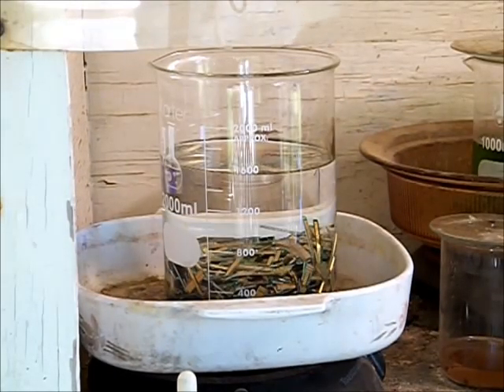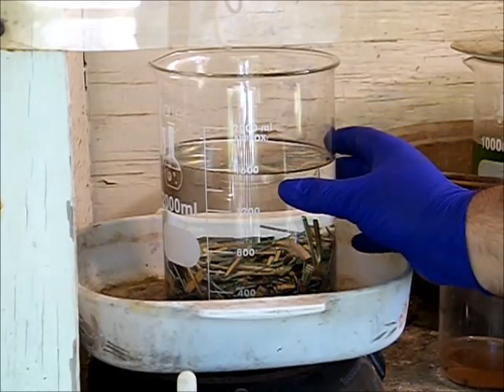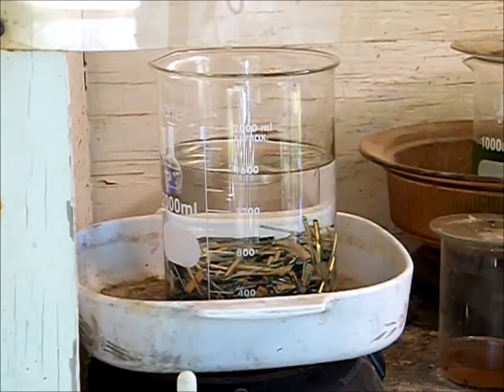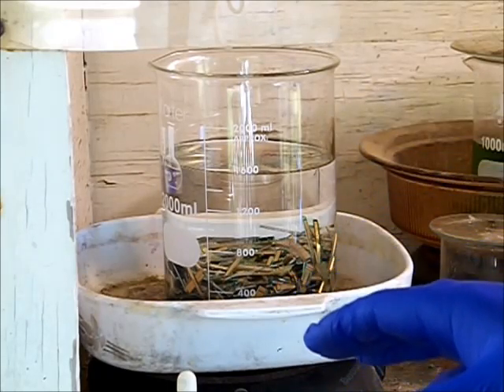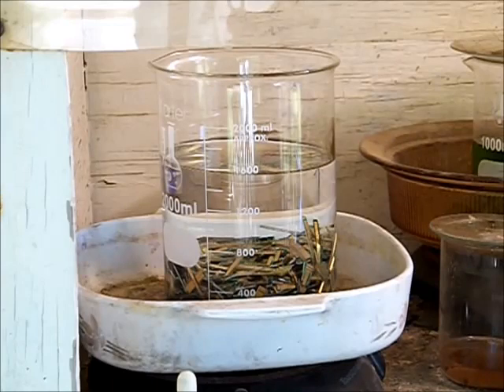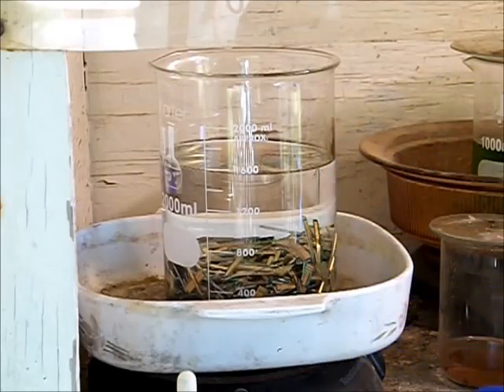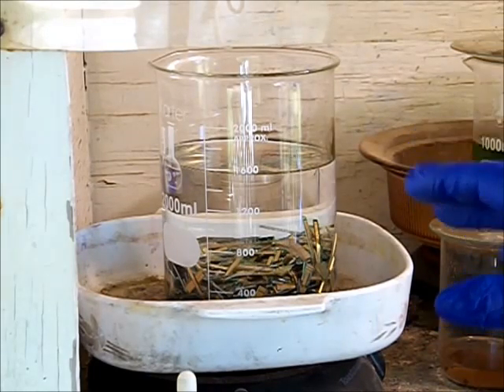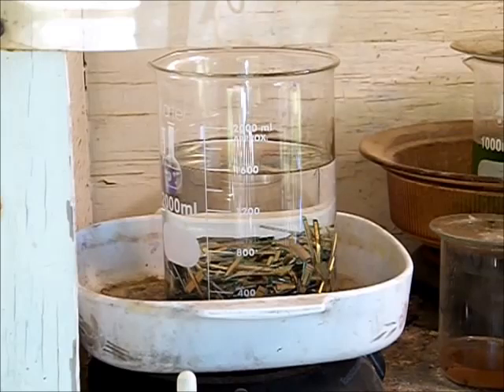Here's a quick rundown. I've added the tap water to my beaker. Volume is very important because water can only hold so much dissolved salt. We're going to be adding salt to it as a nitrate, and we want to dissolve the base metal that's there.